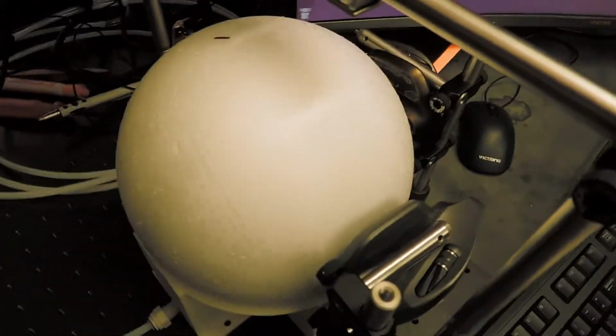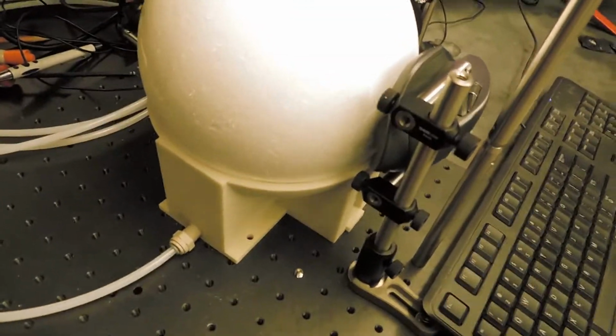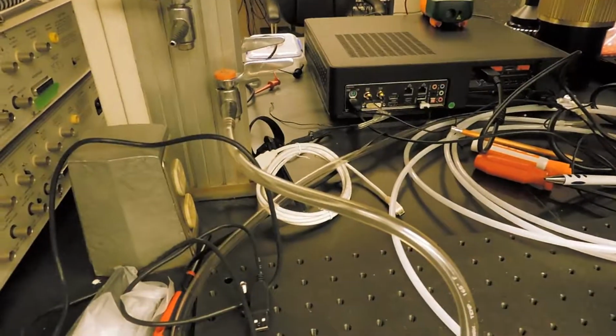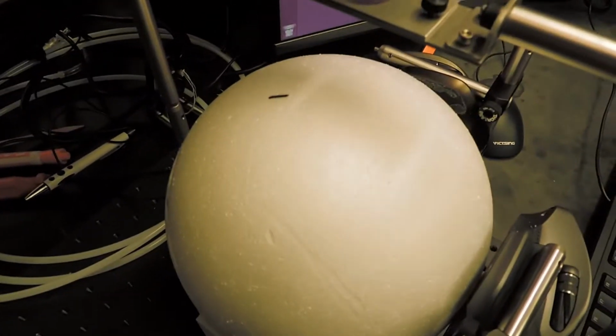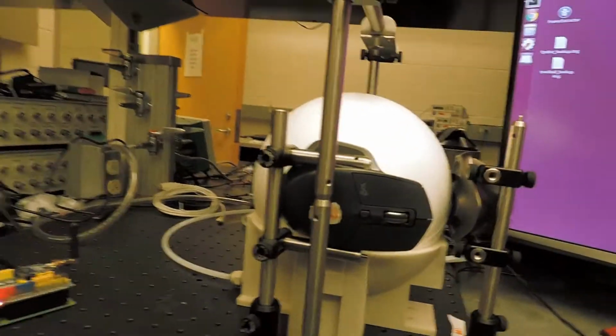This is the trackball. It's suspended in an air bed, so this is a custom printed base that we're pumping air into. And this is very low inertia, which makes it much easier for the mouse to move. This is the head plate, which will fix the head of the mouse while it is under the microscope. And then these two USB mice fixed here are capturing all the rotation data of the trackball.